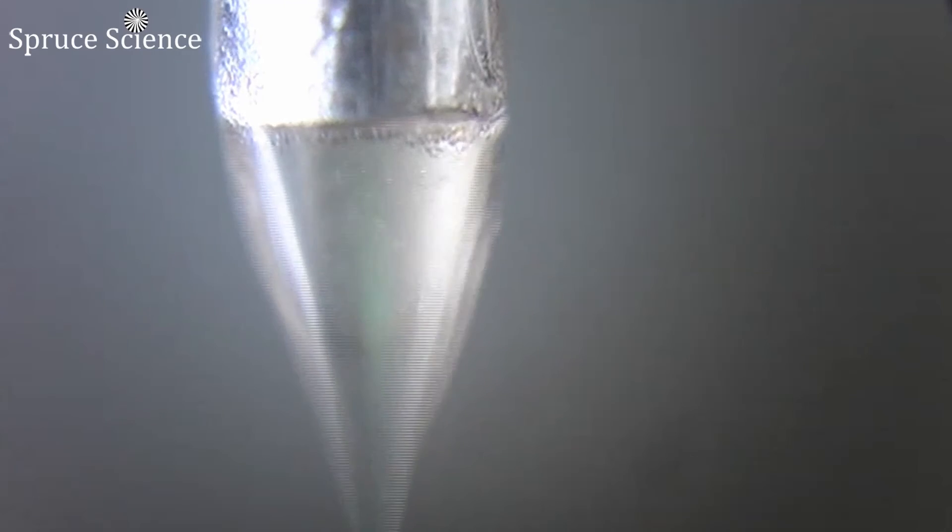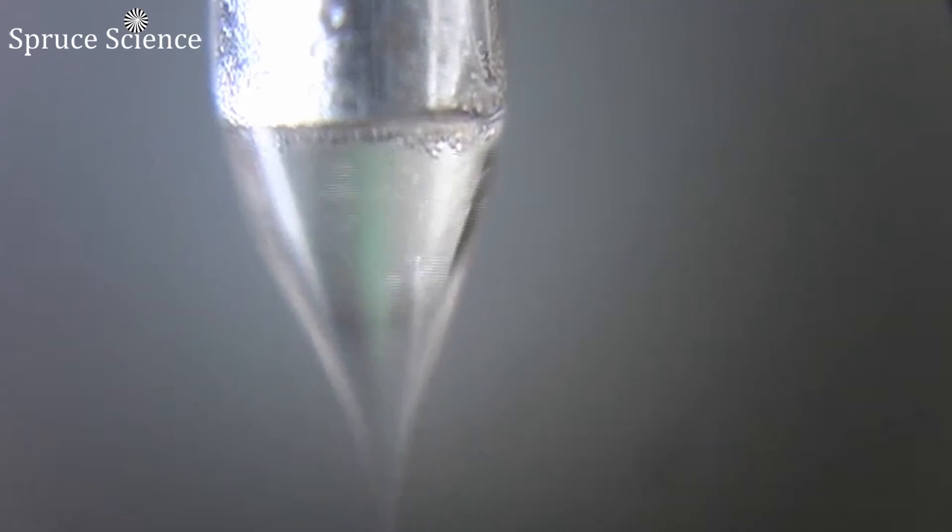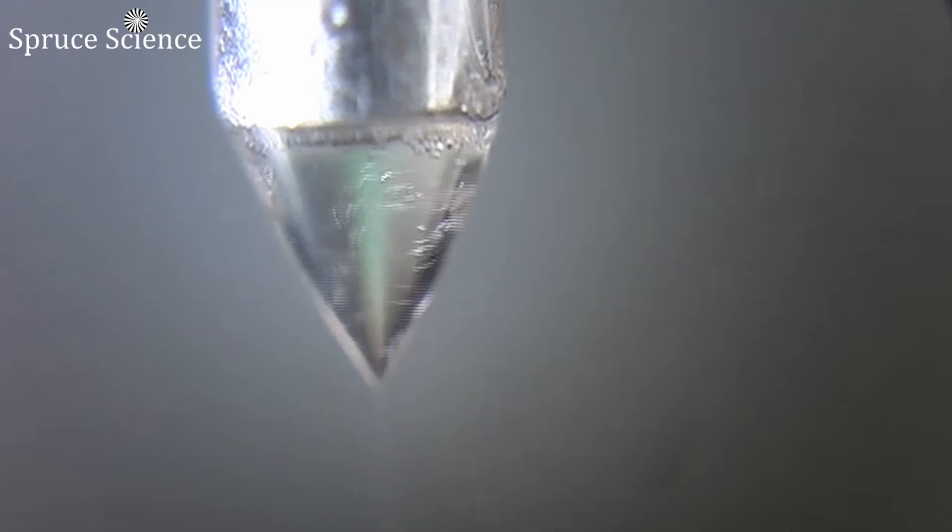However, if the applied electric field is too low, then it leads to instability. For performance tuning, having an adjustable precision high voltage power supply is essential.